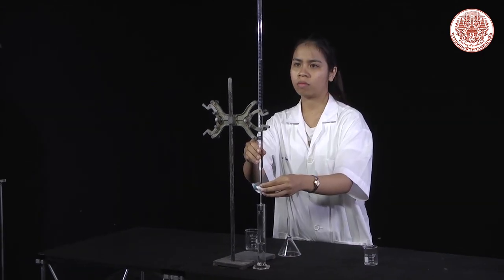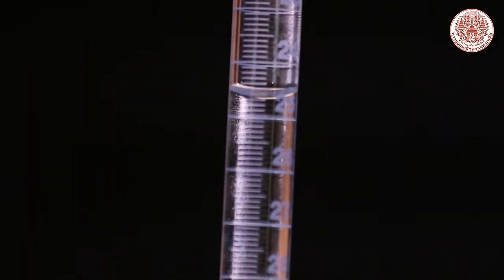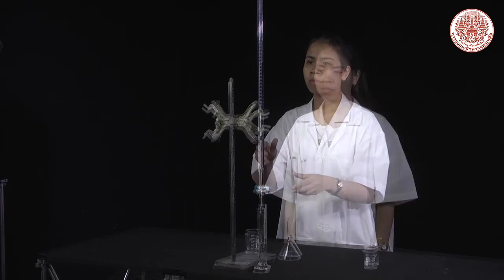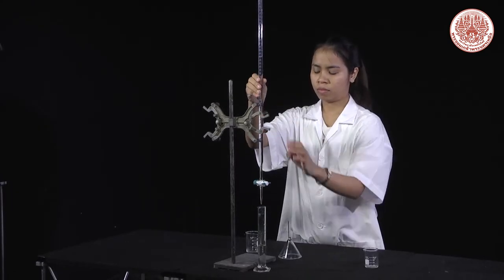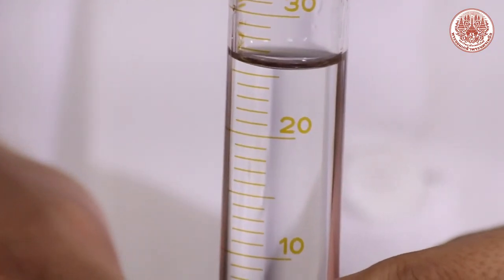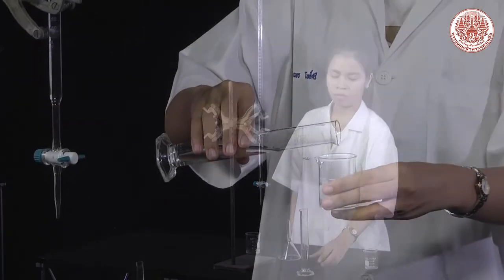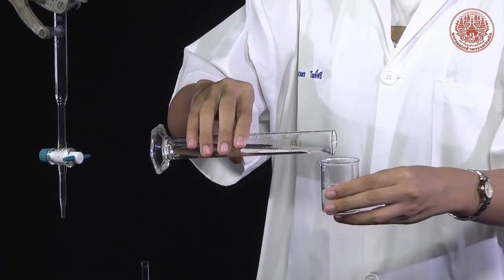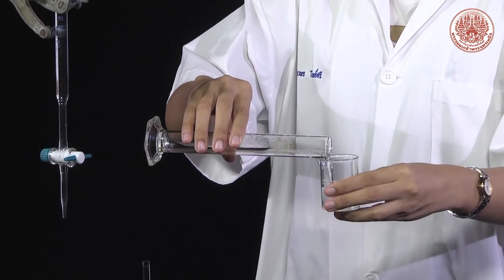Transfer 25 mL of tap water from the burette to the graduated cylinder and read the volume. Then transfer the tap water to a beaker and read the volume from the beaker.